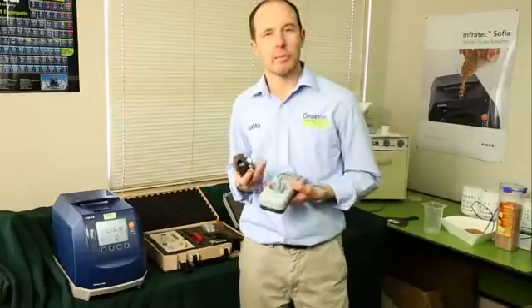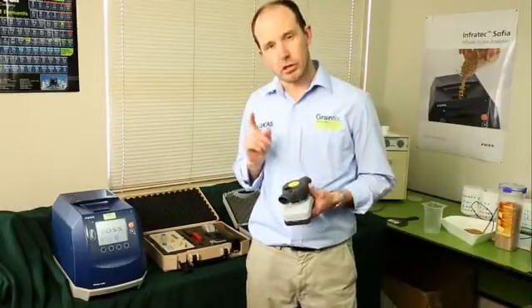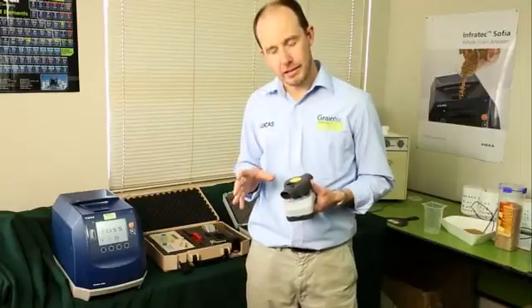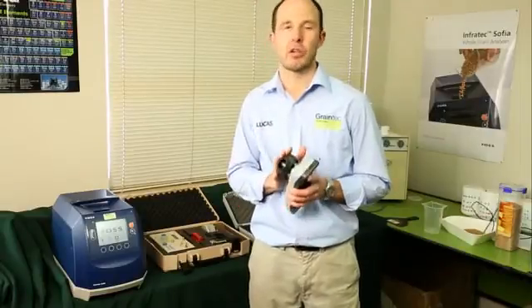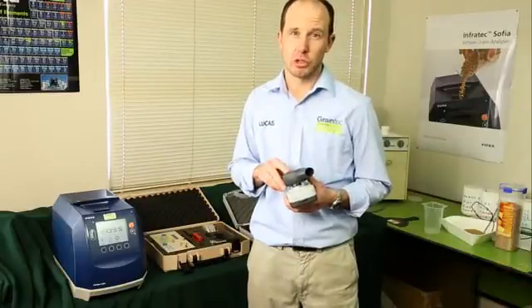The temperature of your grain sample is also important. It's ideal if you make sure that the temperature of your grain is the same as the temperature of your meter. That way you'll get the most accurate moisture reading.